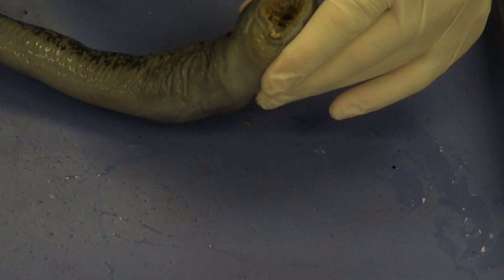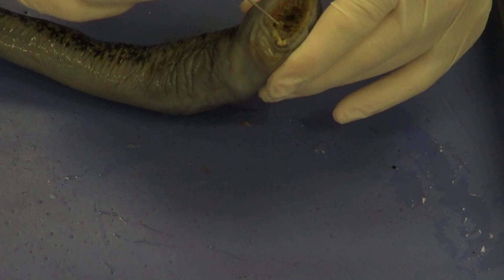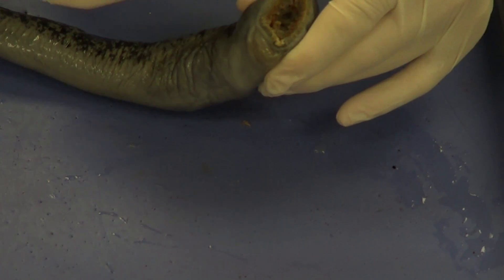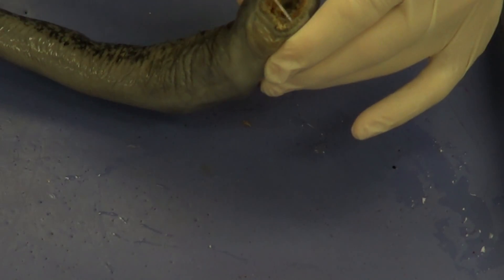This is our mouth again. We see it looks like little fuzz all around the mouth — that is the buccal papillae, sometimes called the sensory papillae. That's actually used to sense touch, especially when the lamprey attaches to the fish. Those are the buccal papillae.